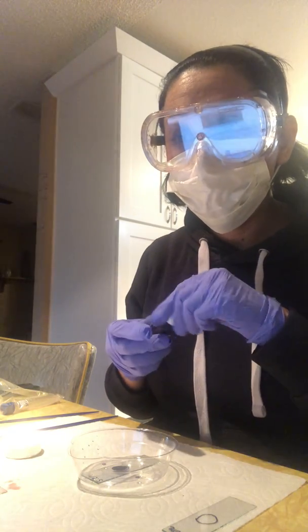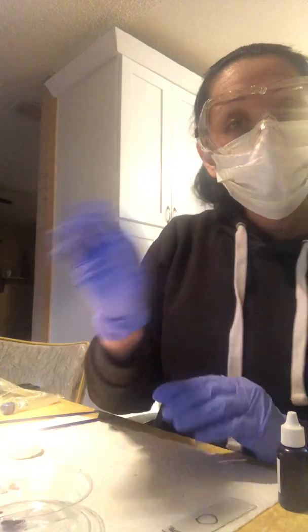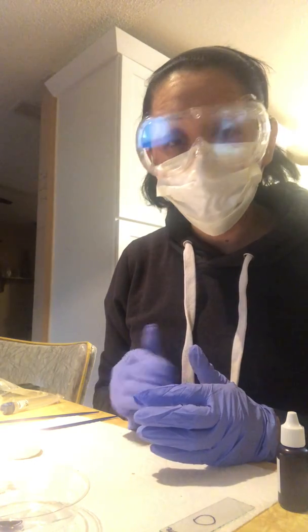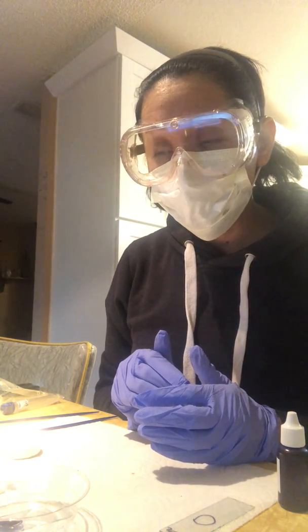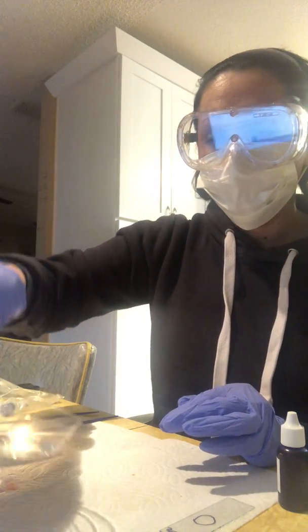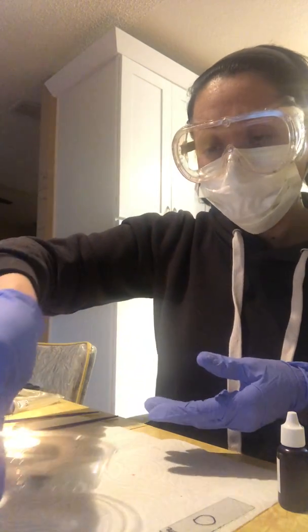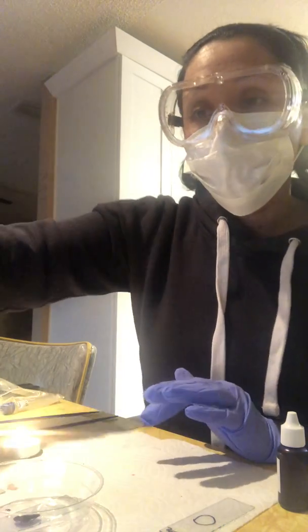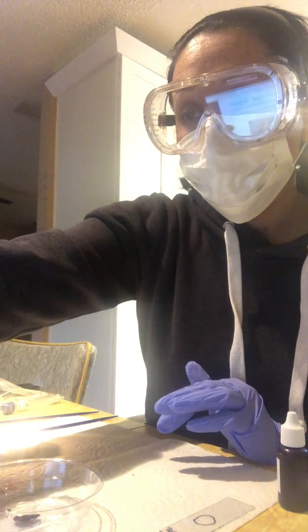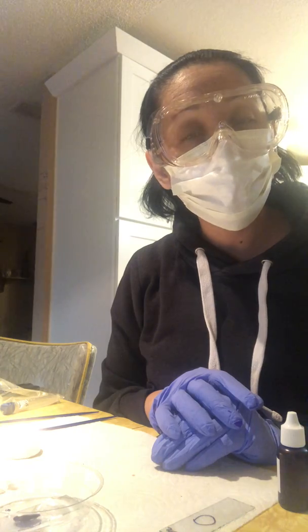I'm also going to do that to the Cerevisiae. And yeah, that concludes my experiment. Once they are nice and dry, and I have washed away the stain with tap water, just in the dish, I'm going to go like this, put the water in there a little bit, let it come out, and once they're dry, then I will be able to take pictures of them from the microscope. So I'm excited. Thank you.